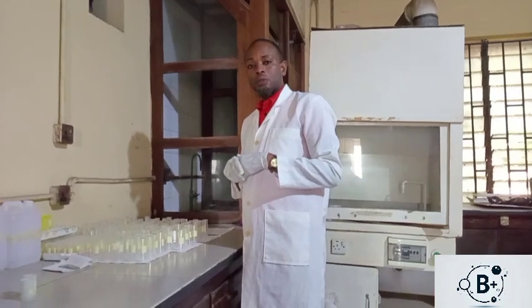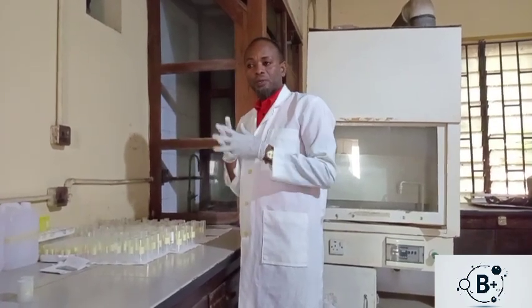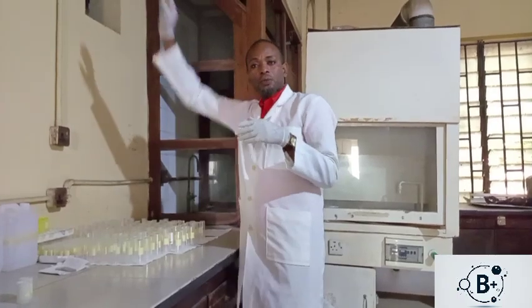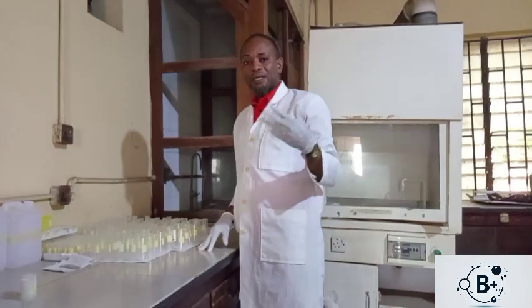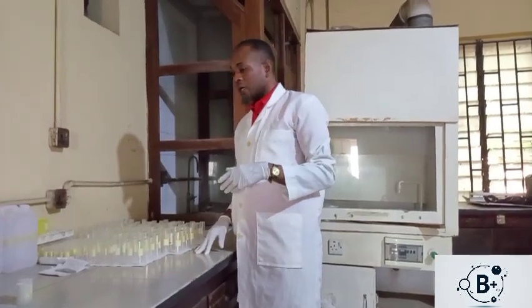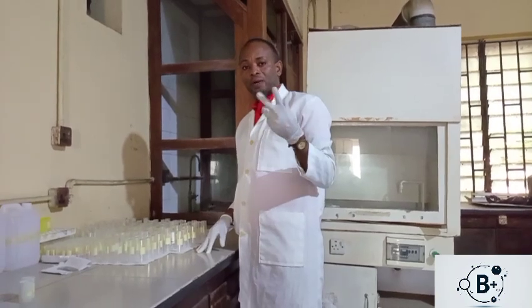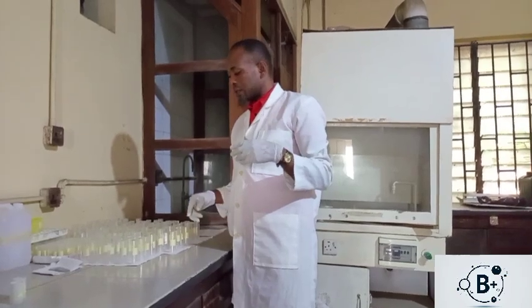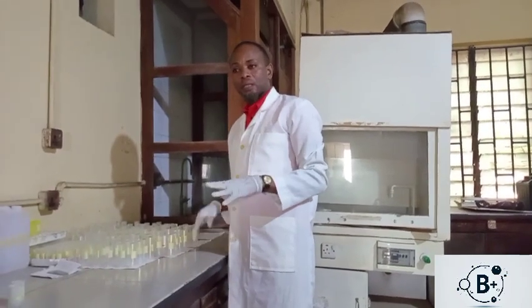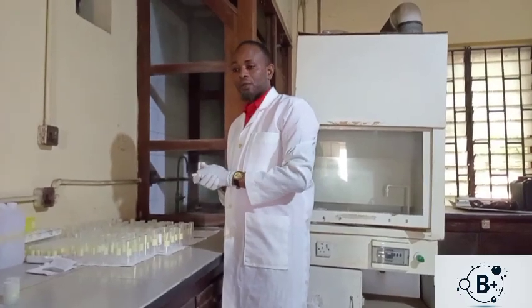You do euthanasia. Euthanasia is mercy killing. So you ensure that you follow the procedure and the ethics of animal sacrificing, such that overall harm is not done to the animals, and it is done according to international standards. So these are the requirements you have to put in place.